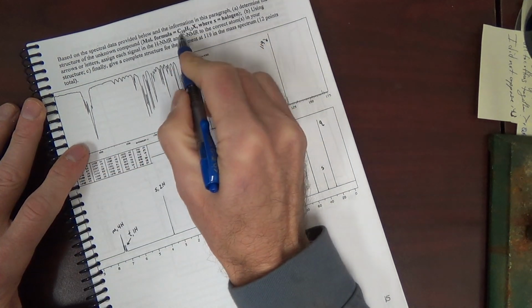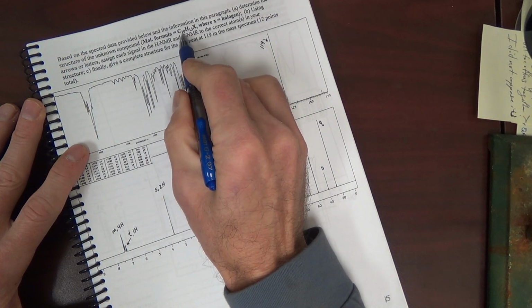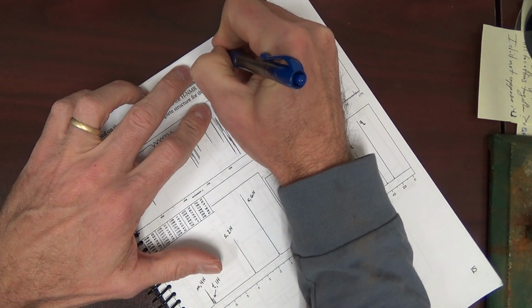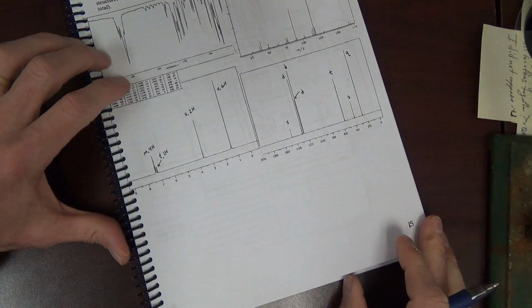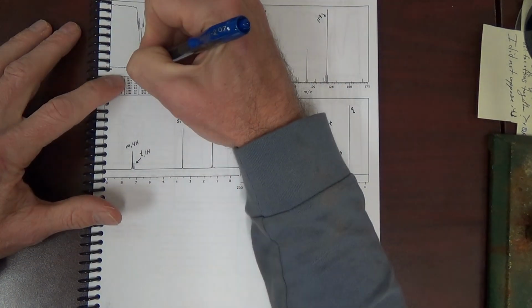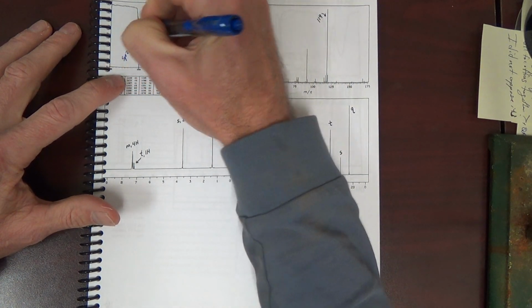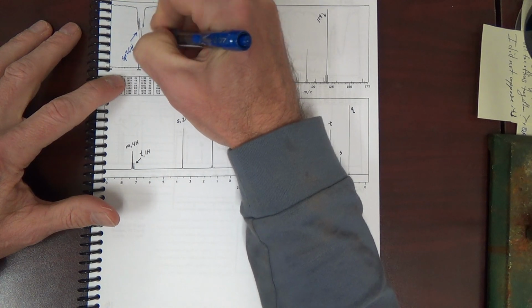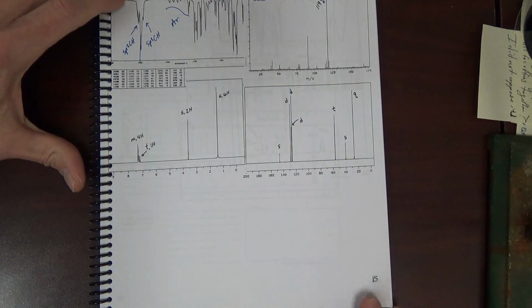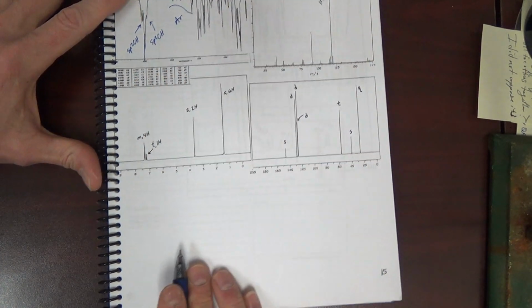Let's see, DUS. X halogen counts as an H, so that's 14, 22, it's missing 8, 4 DUS. IR sort of has the sp2 CH, sp3 CH. This looks like an aromatic signature. Looks like it has an aromatic ring. The formula supports a benzene ring.